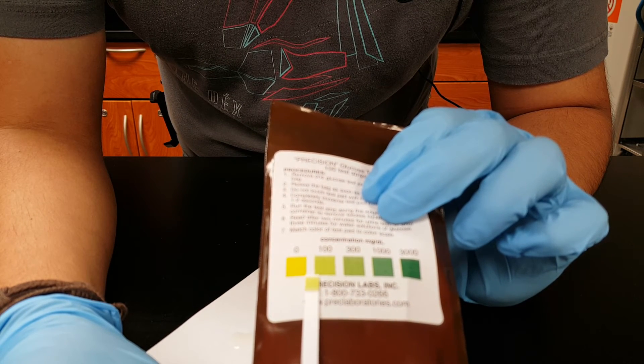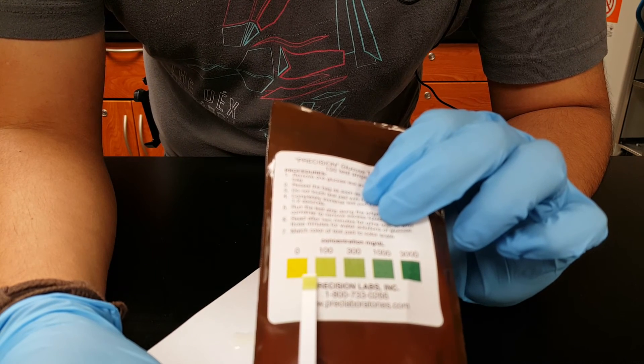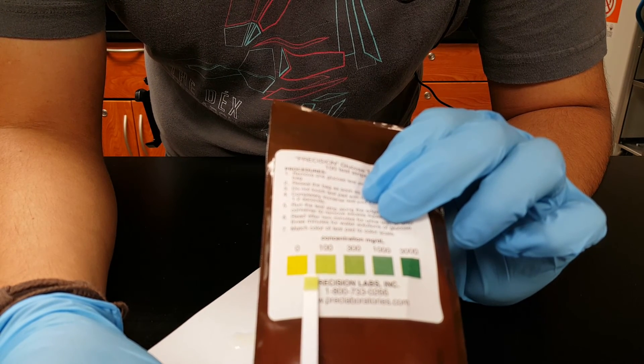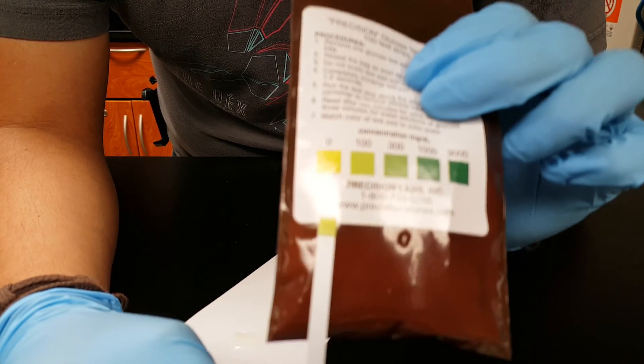And that's all you do. You do the same thing for your own readings at room temp, 37 degrees and 100 degrees. Okay, that's about it. Good luck with your experiment.